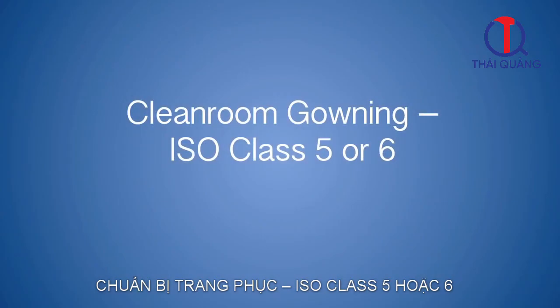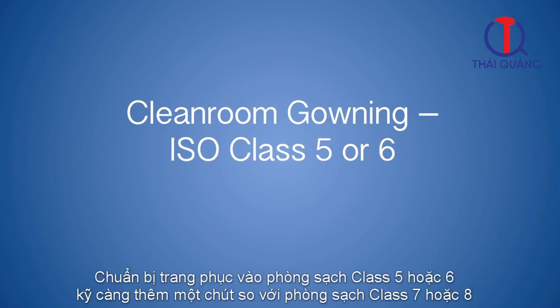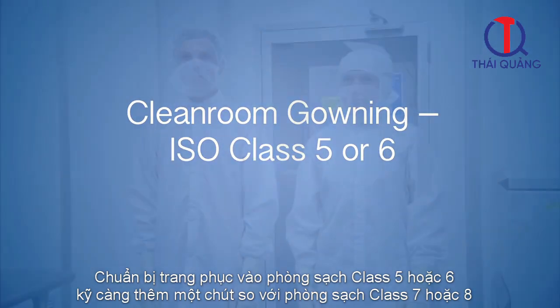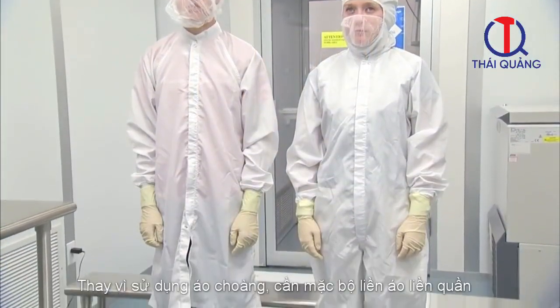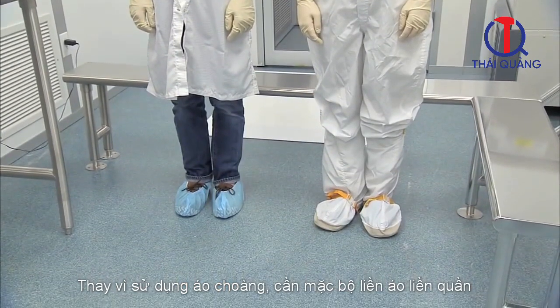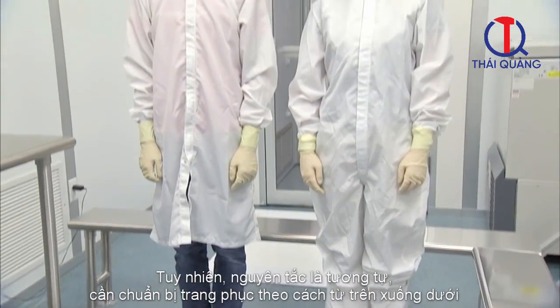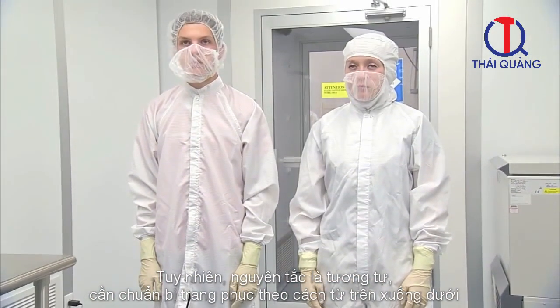Cleanroom gowning, ISO Class 5 or 6. Gowning for an ISO Class 5 or 6 cleanroom is slightly different than gowning up for an ISO Class 7 or 8 cleanroom. Instead of a smock, a full set of coveralls, or bunny suit, must be worn. However, the same principle as before follows, and the gowning process should go from the top down, starting at the head.